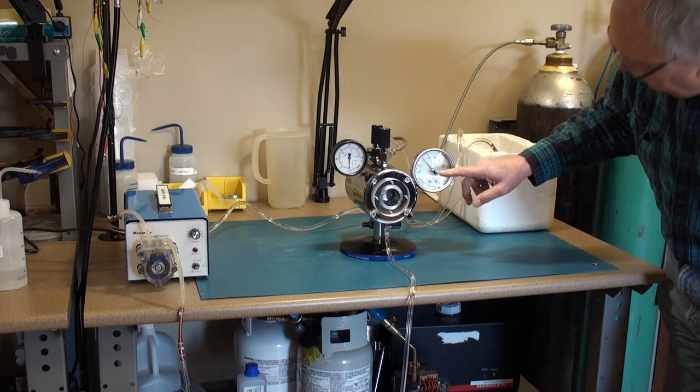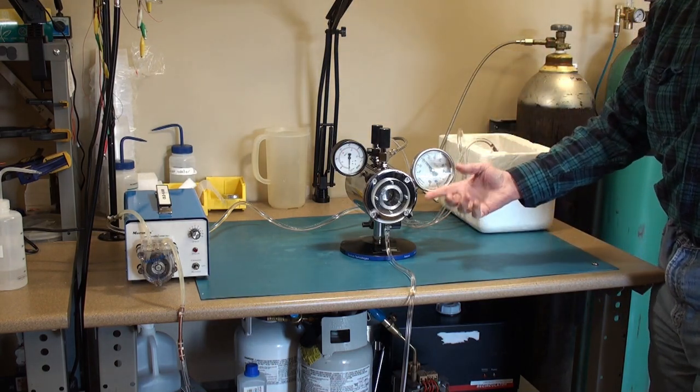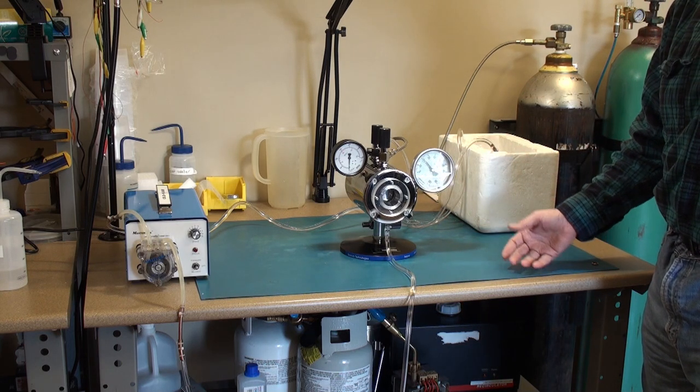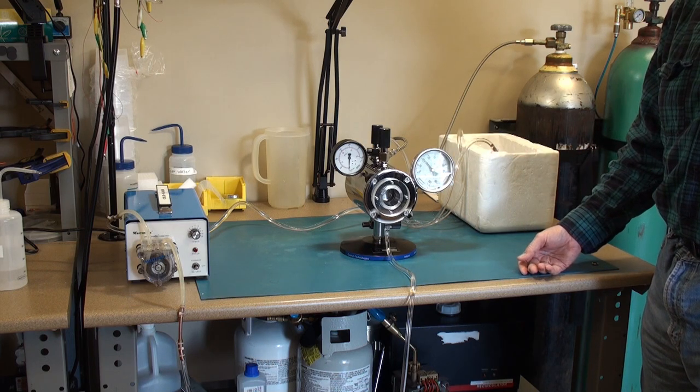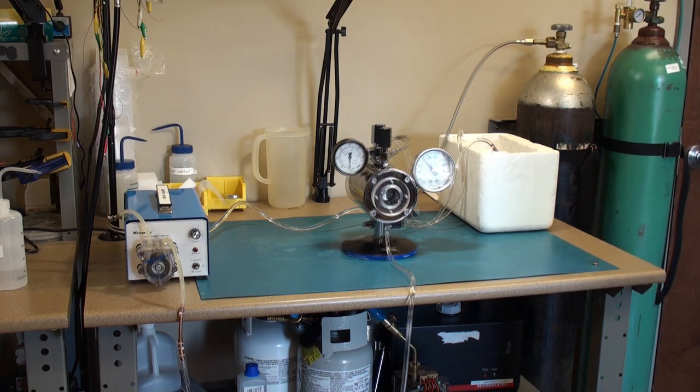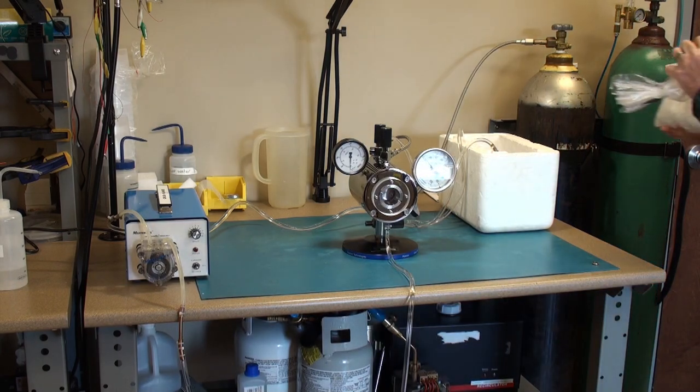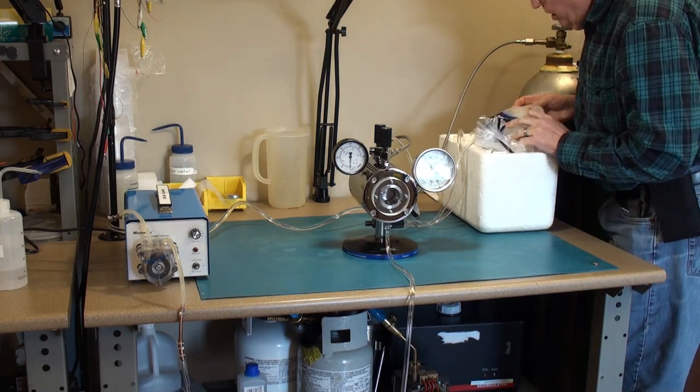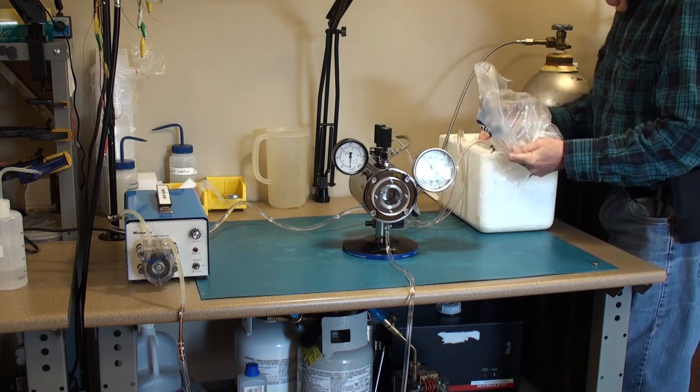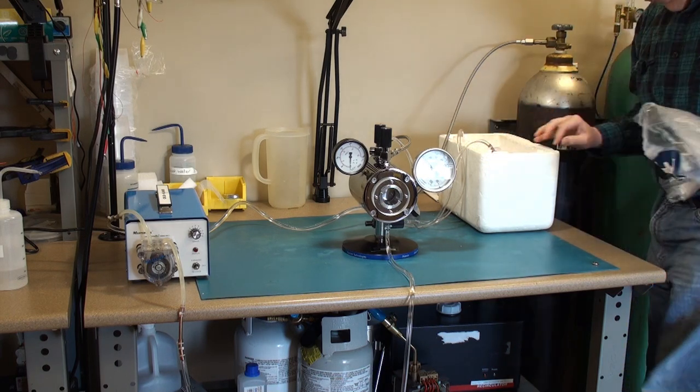And get this down from right now it's almost 22 degrees Celsius. I'm going to get it as cold as I can. Generally I like to work around 5 degrees. And then we'll introduce CO2 and move forward from there.